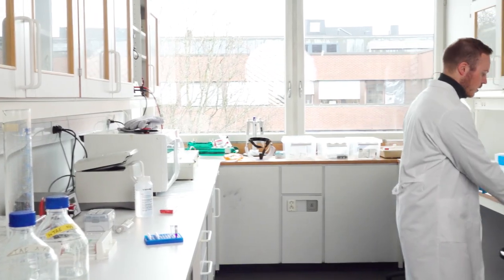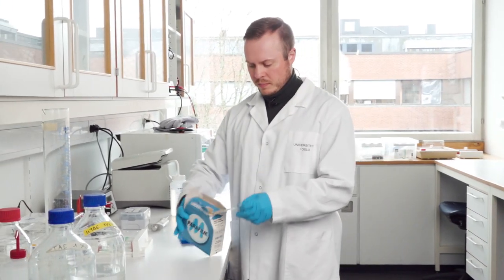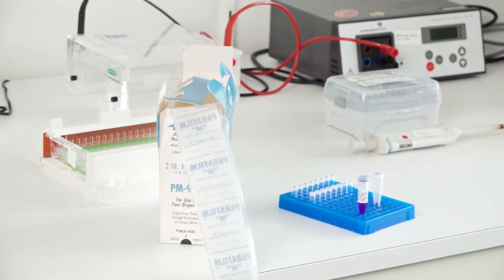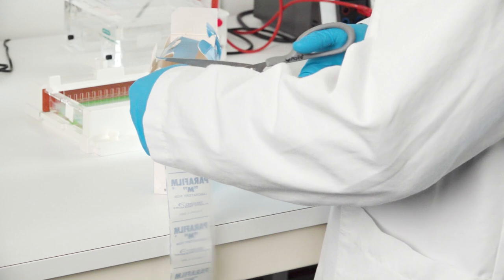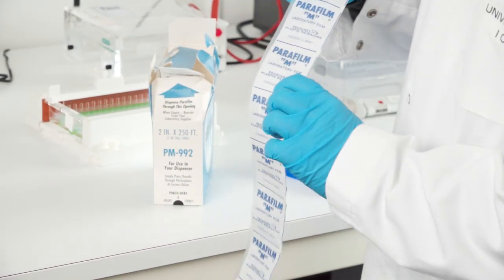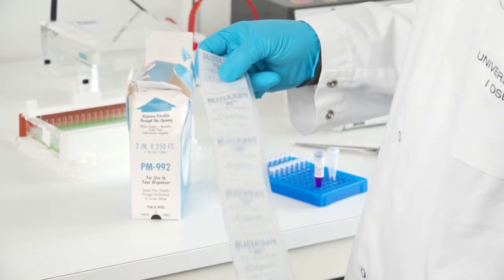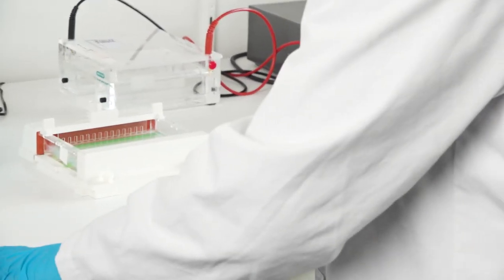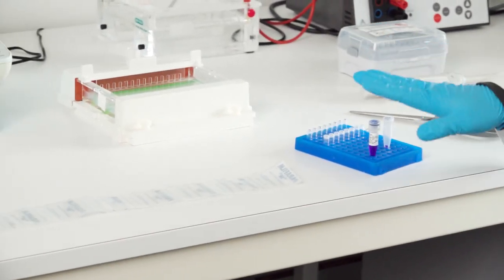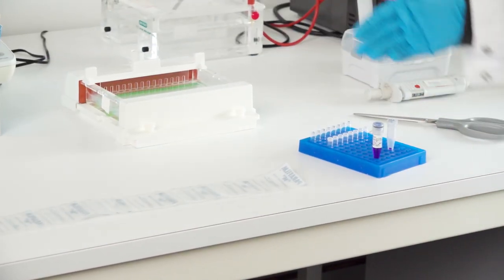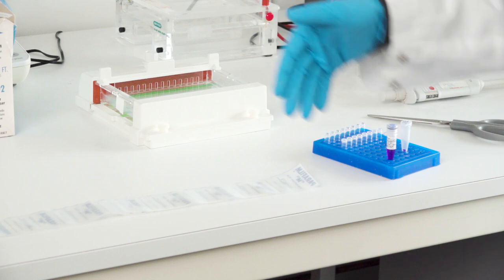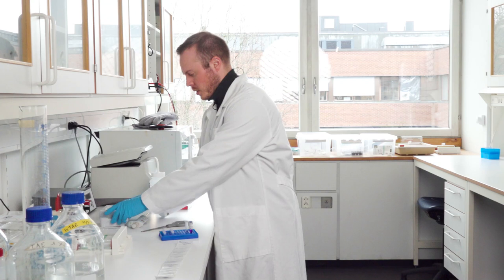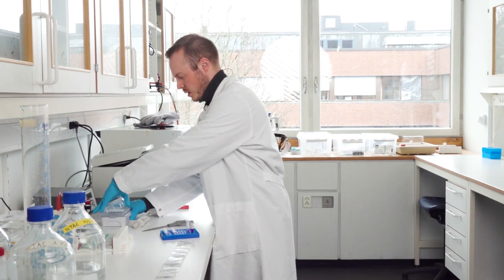The next thing I need is Parafilm which is very usable for a lot of applications. This has a paper surface and a blank surface and we use the blank surface to pipette the solutions in small dots here that we mix our samples with before we load it into the gel. But before we do that we can check if our gel is actually ready.